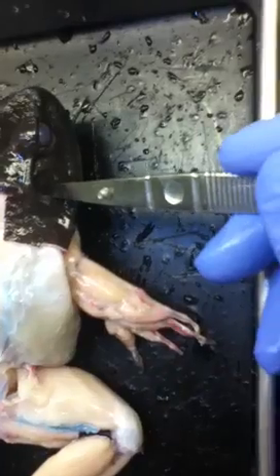Ok kids, do a little wrap-up of what we've done so far with this frog in case you're studying for the test or whatever. Right here behind the ear is going to be the tympanic membrane. The eye underneath — it comes up over the eye when they swim — is going to be the nictitating membrane.